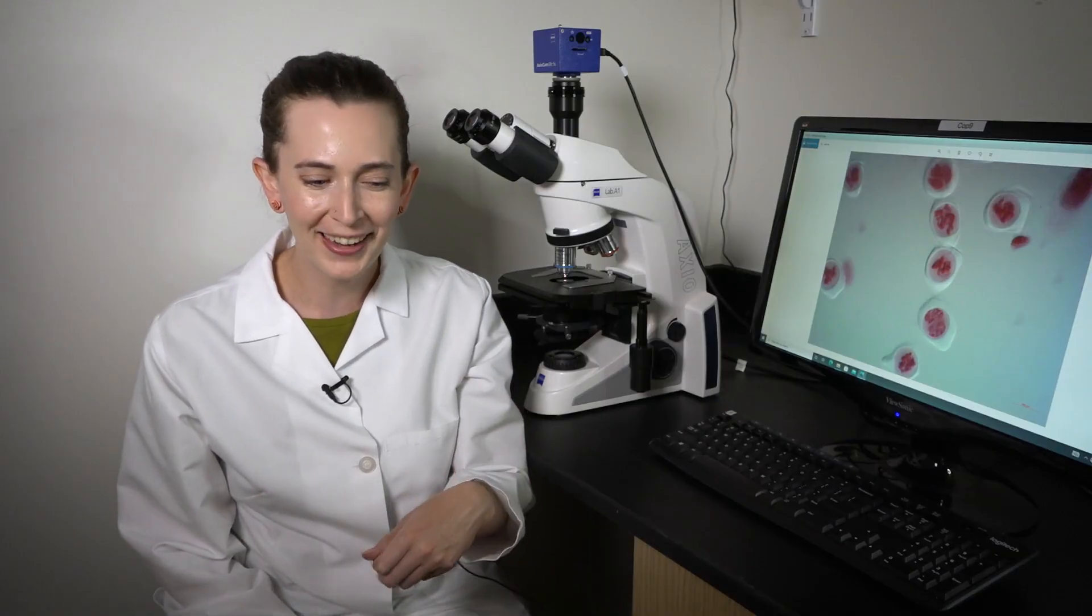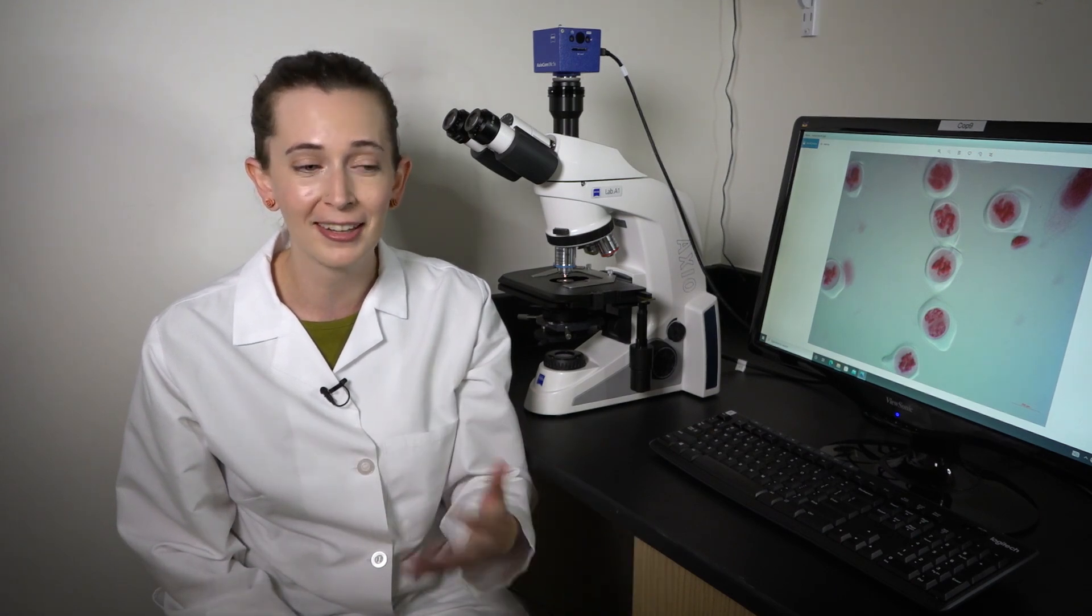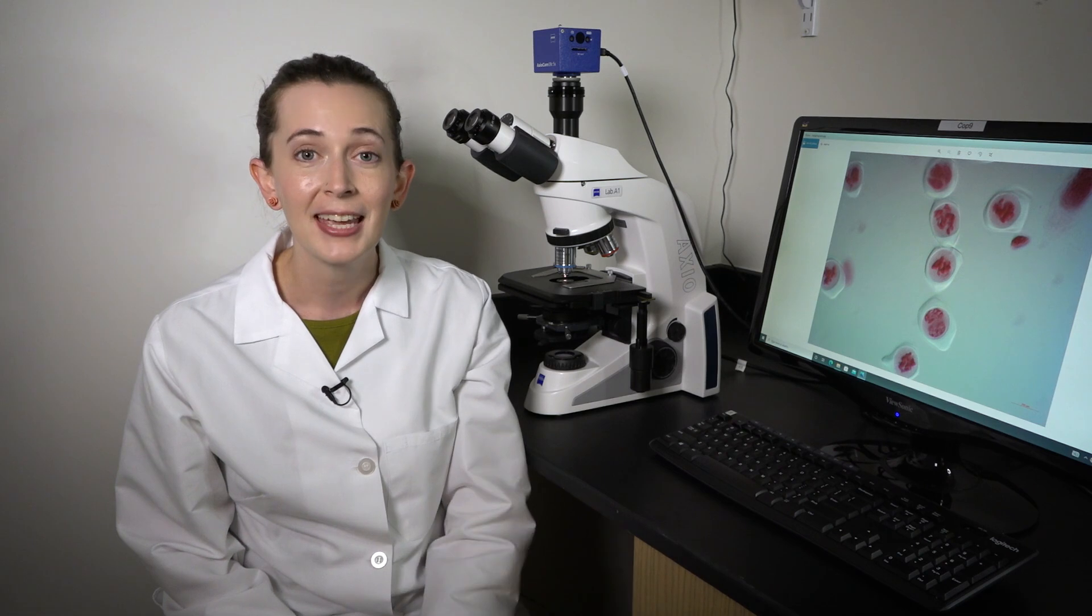Remember, this protocol is a little finicky. Sometimes you can over squish the anthers and cause your cells to break. Sometimes you'll have to look at a bunch of different flowers to get all of the phases of meiosis. It took me a bunch of tries to get it the first time, so don't be discouraged if you don't get it right away.